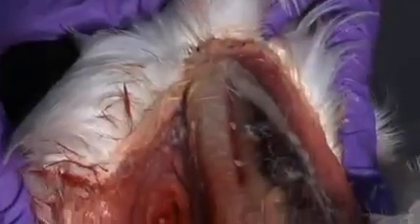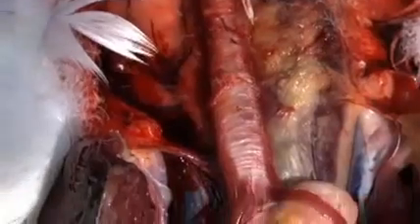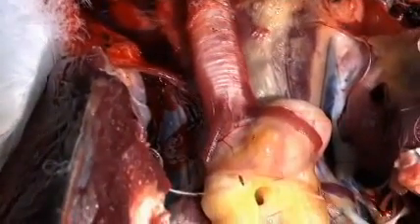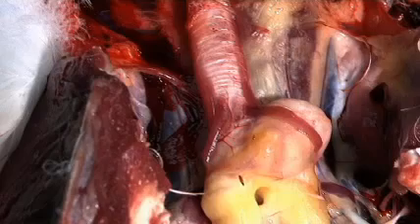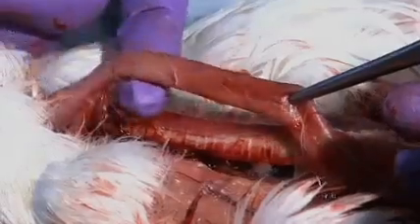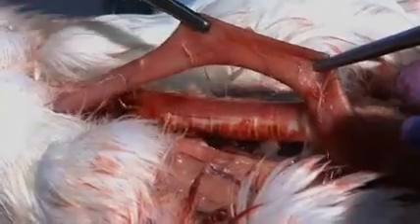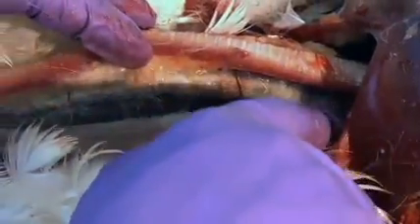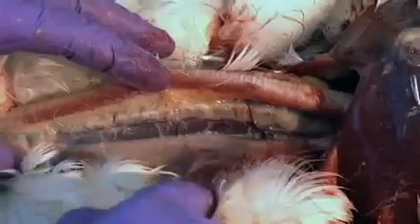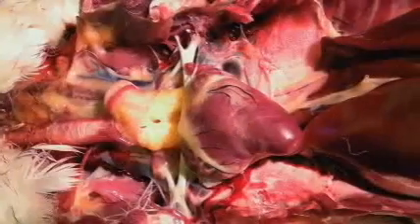The outer surface of the trachea should be pink, with white cartilaginous rings encircling it along its length. Inspect the trachea and syrinx for any hemorrhages or other lesions. Adjacent to the trachea lies the esophagus. In ducks, the esophagus should be pink and very elastic. Note that ducks, unlike chickens, do not have a crop associated with the distal esophagus.